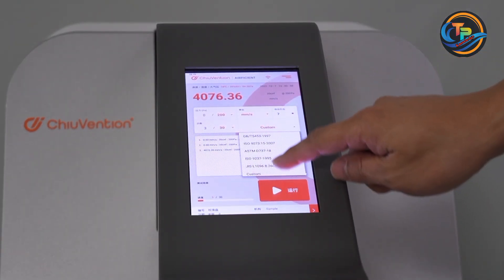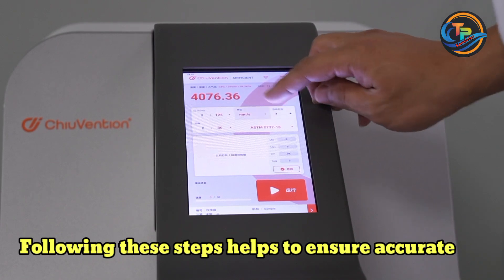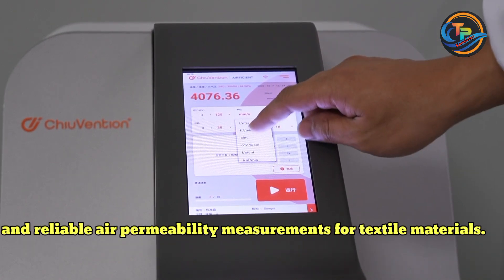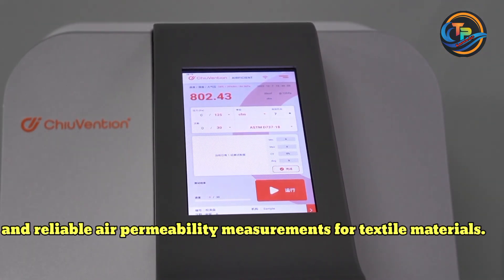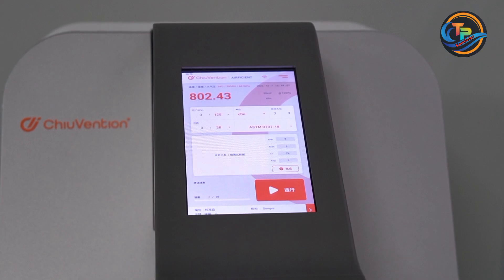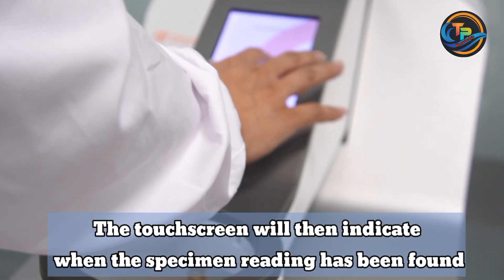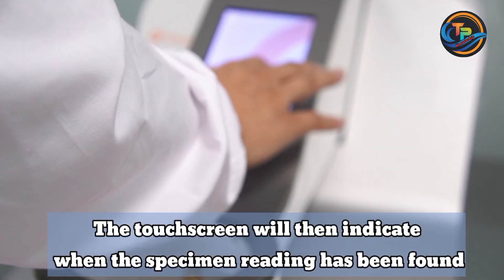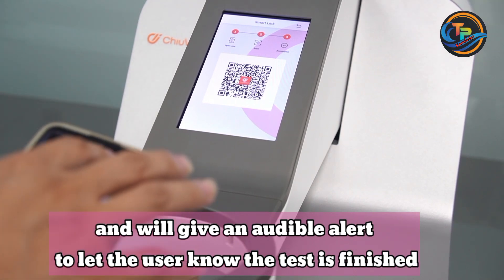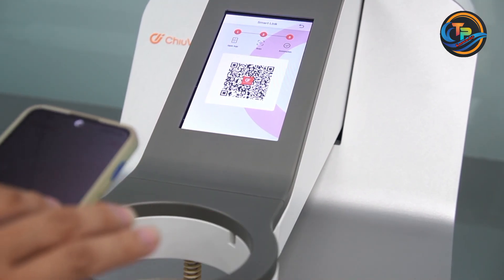Following these steps helps to ensure accurate and reliable air permeability measurements for textile materials. The touch screen will indicate when the specimen reading has been found and will give an audible alert to let the user know the test is finished. Finally, we get the result.